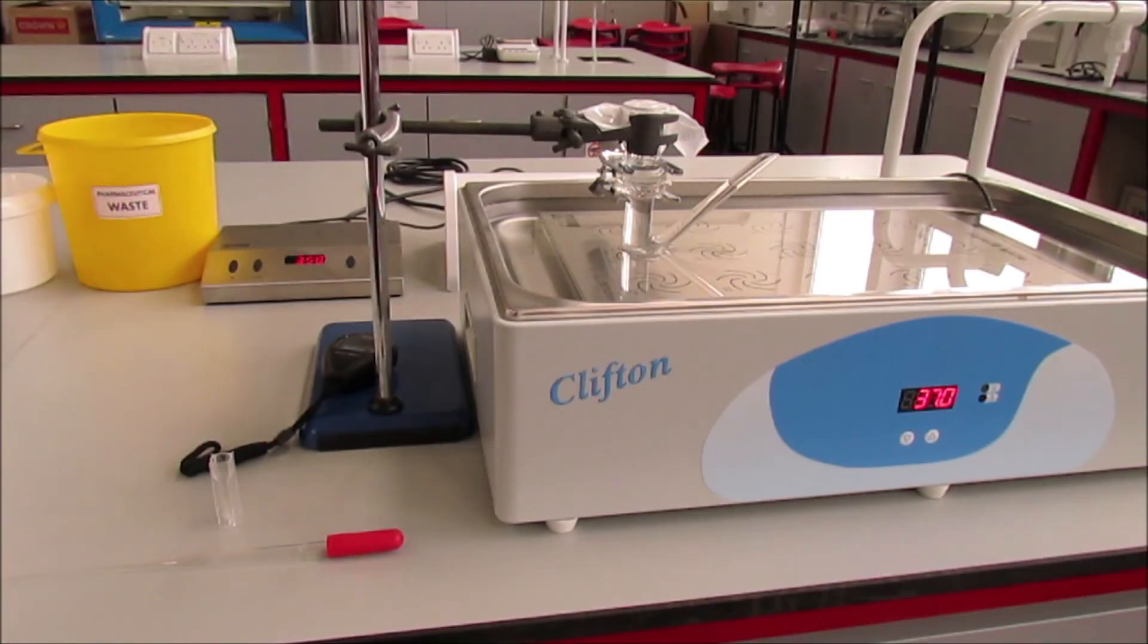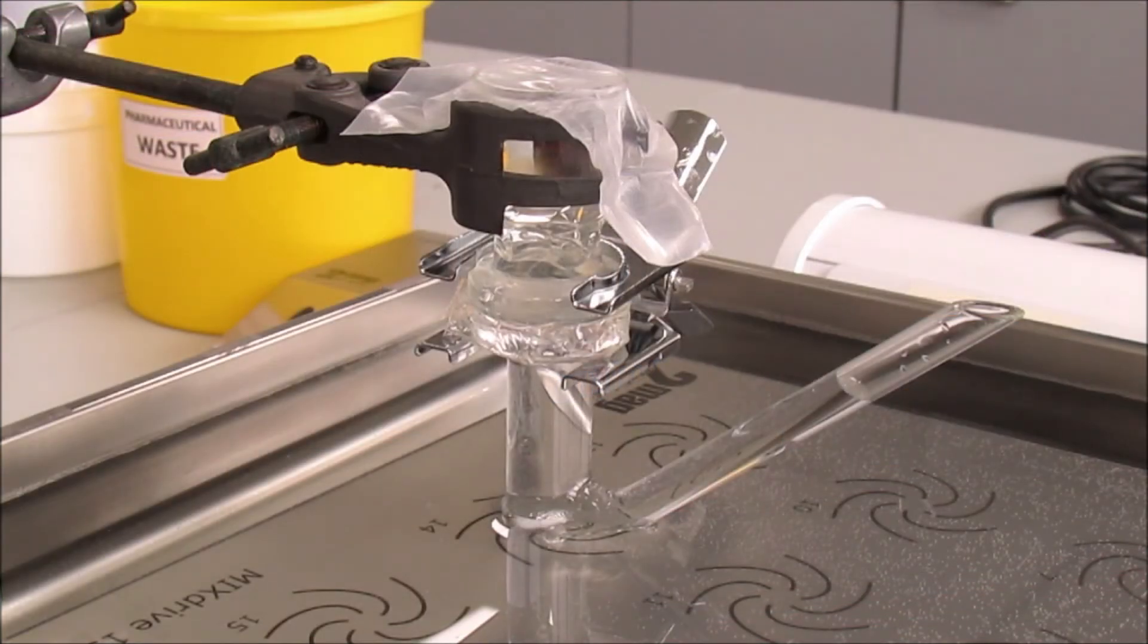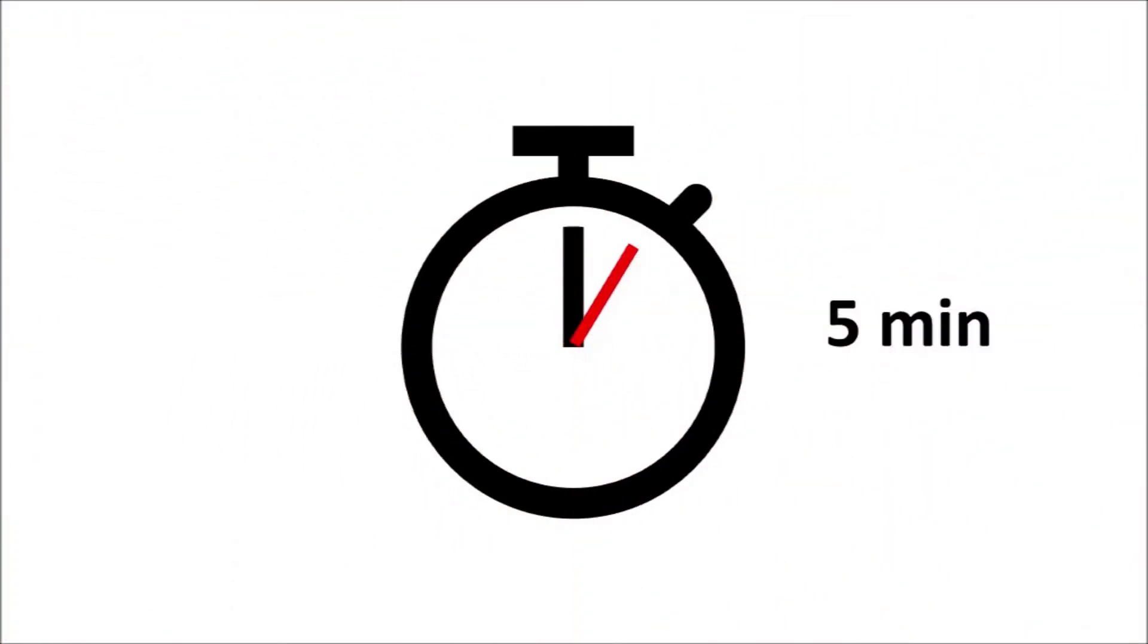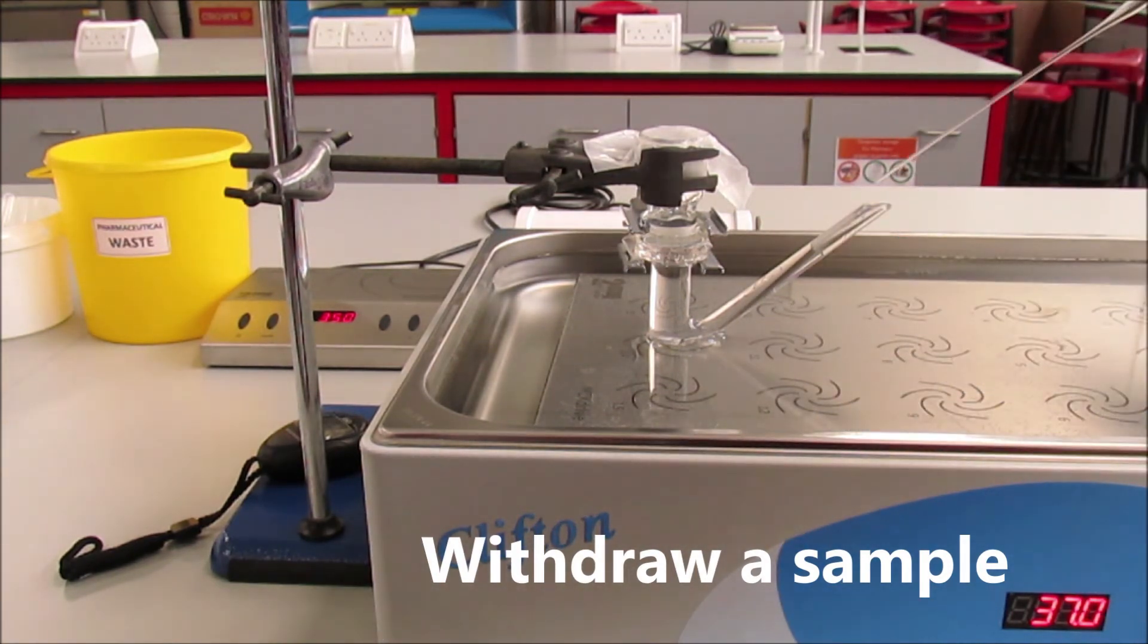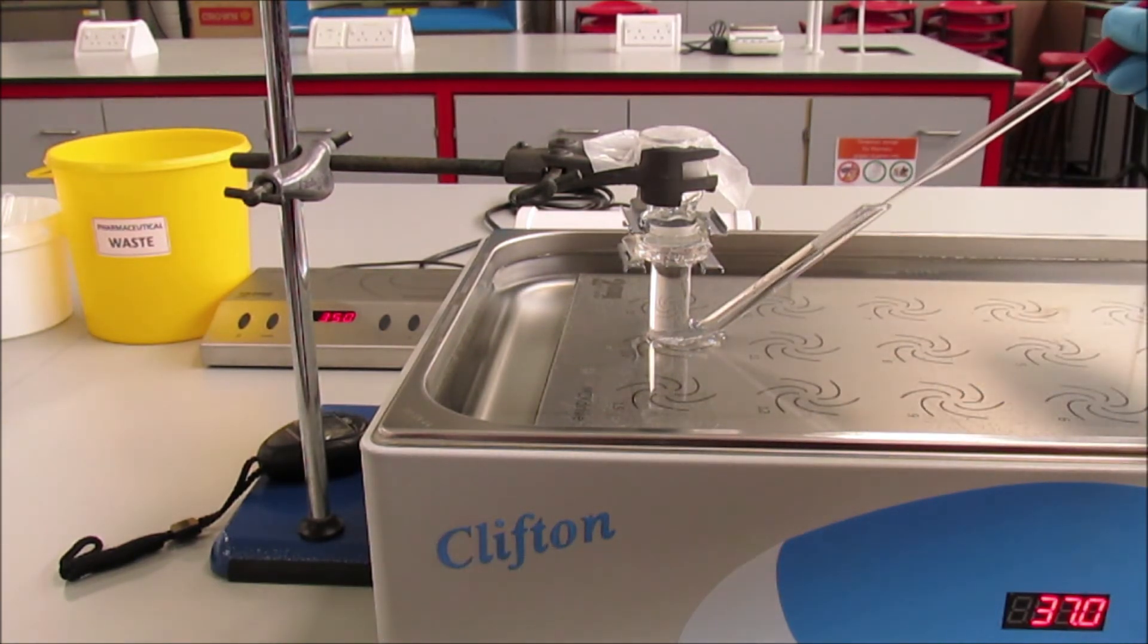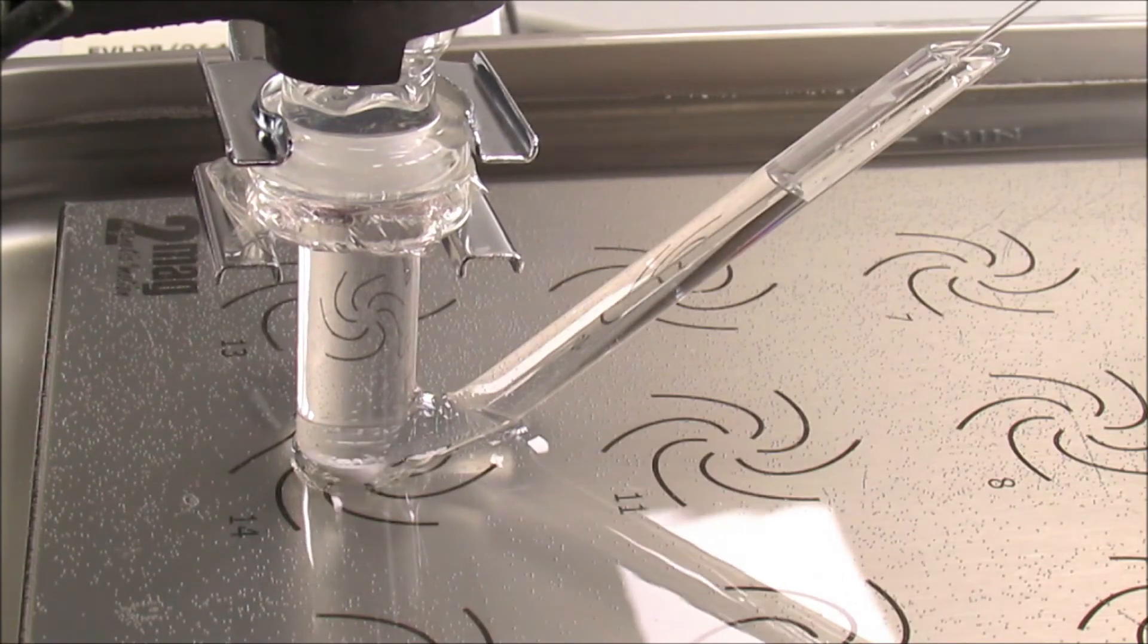We will be taking samples at different time intervals, every five minutes, taking samples and measuring their absorbance spectrophotometrically.